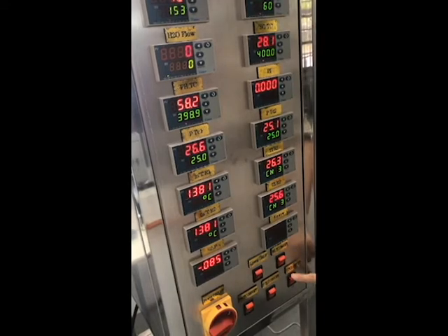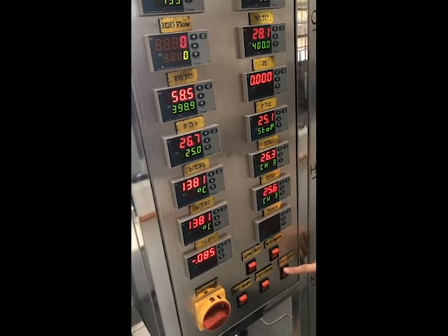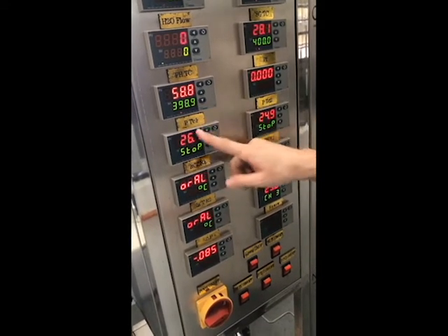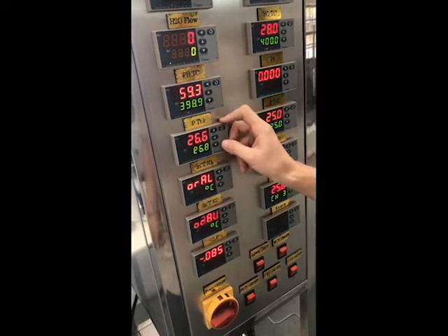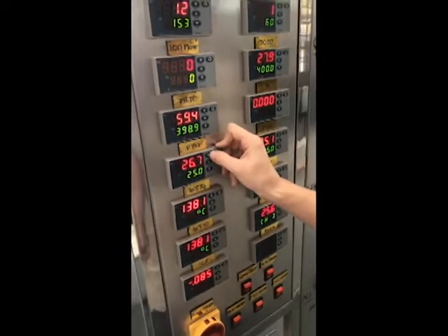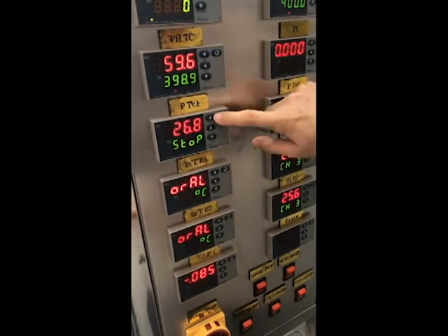You don't even need to turn it on, because both furnaces are controlled individually. So you can turn on only program temperature 1. This is the most important part, sending your program. How to send your program? You can record, focus on here. Click this left key.